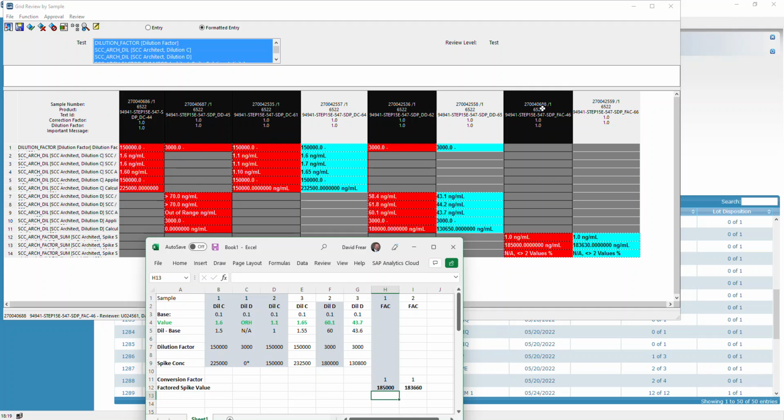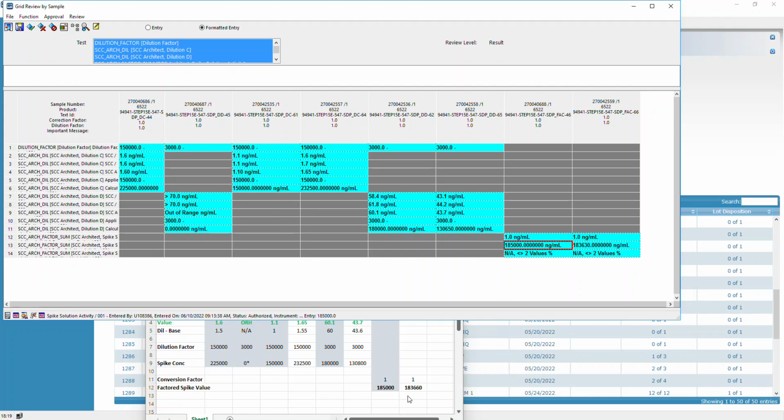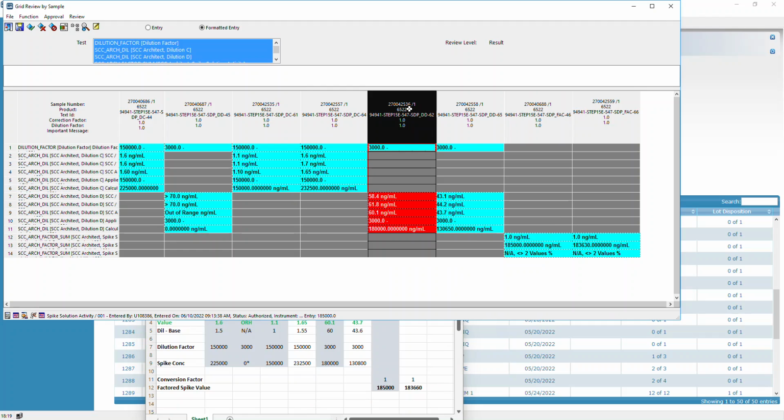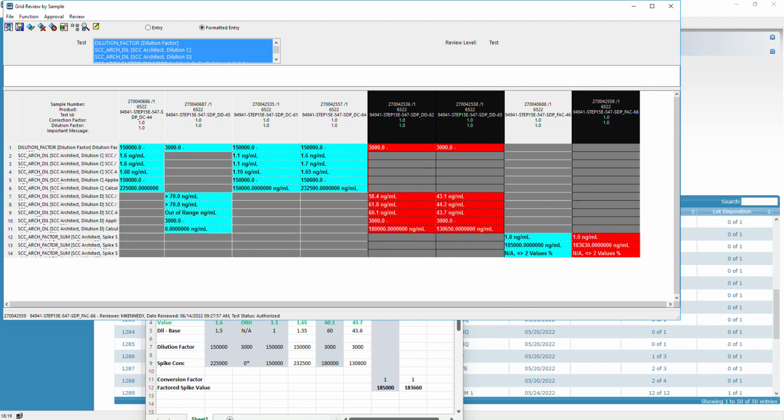But ultimately, this sample here was approved and locked in at 185,000. Then subsequently, these additional samples were taken across all 3 samples, including the factor summary. So in this case, this didn't necessarily have to be done since no samples were canceled.